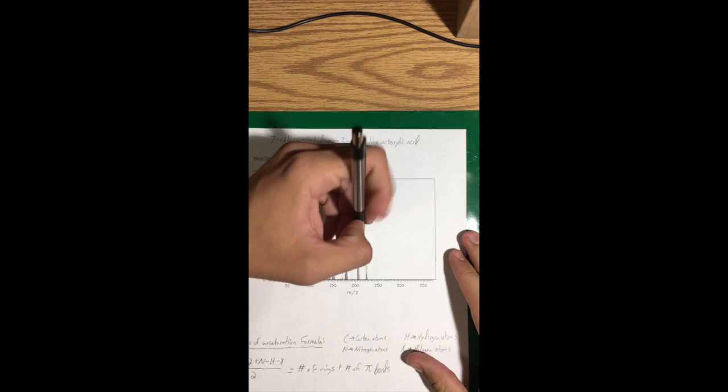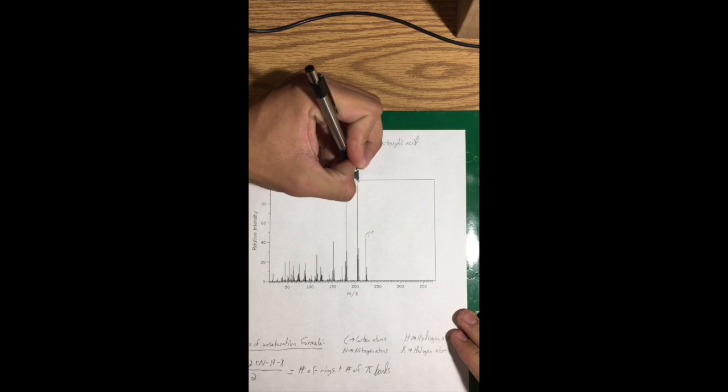Today we'll be looking at a molecule of 7-chloro, 4-hydroxy, 3-quinoline carboxylic acid. First thing we'll look at is the mass spec. Farthest over to the right here will be labeled as M+, which is the mass of the molecular ion right here, 223. Base peak is where the relative intensity goes all the way up to 100. Label that the base peak.